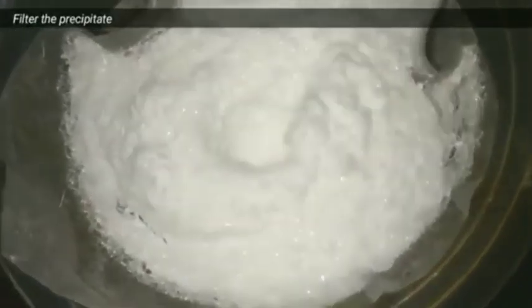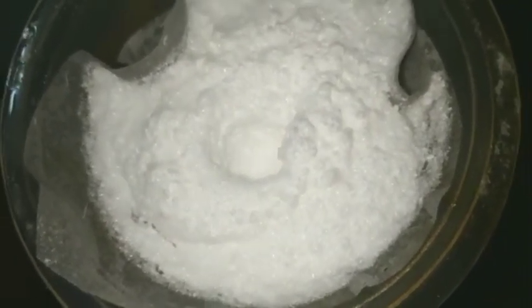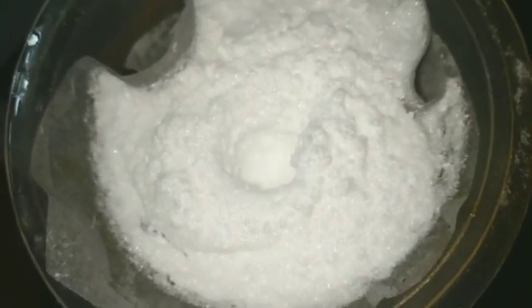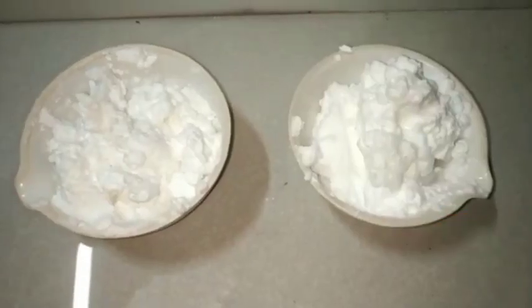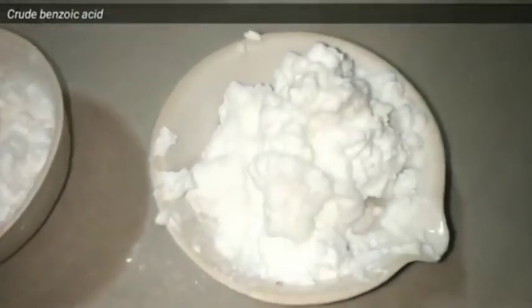After the washing step, we filter the precipitate and again wash it a couple of times with cold distilled water. And finally, this is the crude precipitate of benzoic acid that I collected.